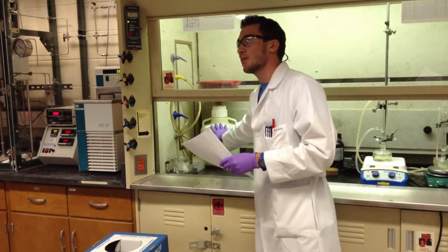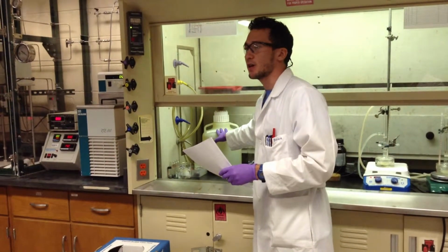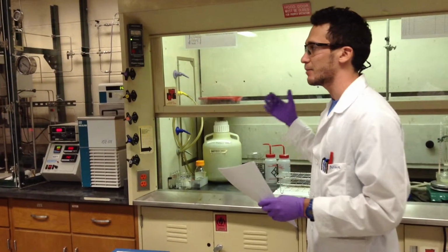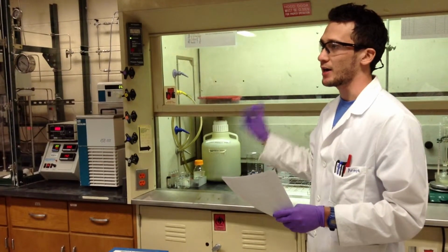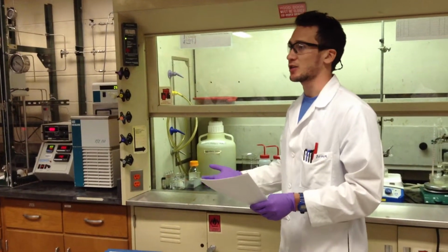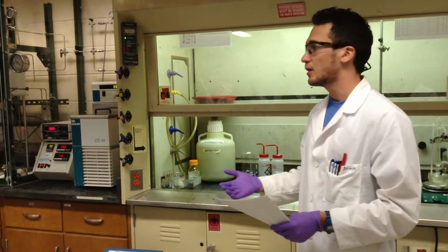For example, for the hydrocarbon waste, we have to keep a record of what we put in there, because we basically mix any type of hydrocarbons in there. But when we're going to dispose of it, we take that bottle out, and we have to tell the people that come pick it up what is in there. If we don't know what is in there, it's an unknown waste, and it's really expensive to treat because they have to figure out first what it is. So that's why we have to tell them carefully what it is.